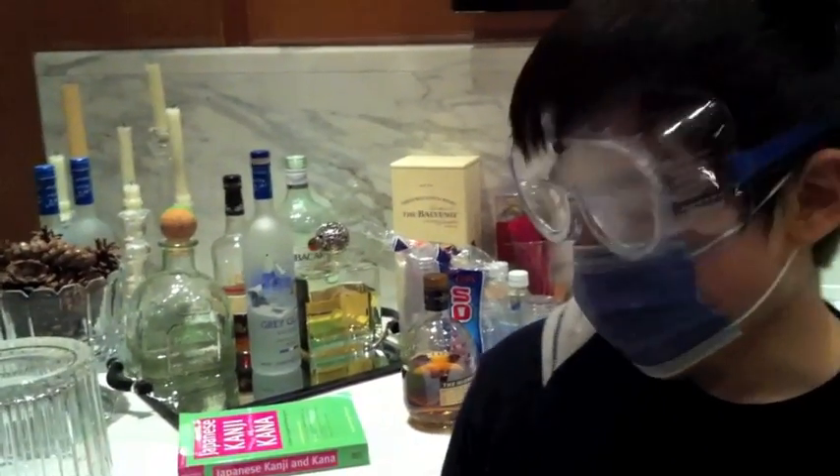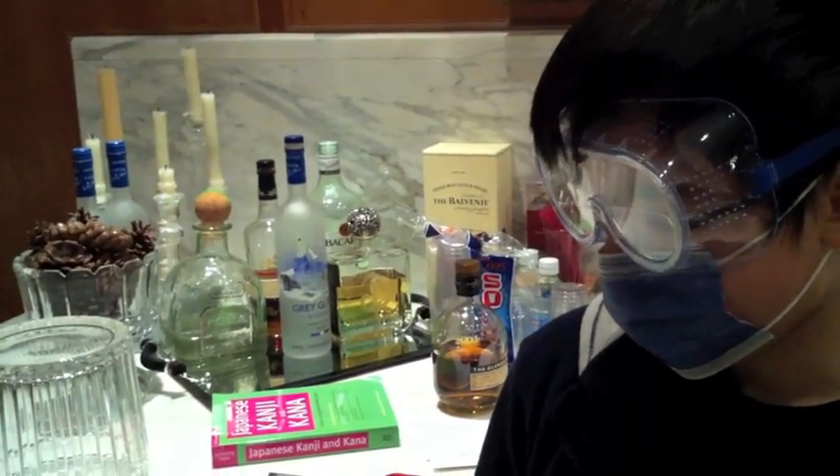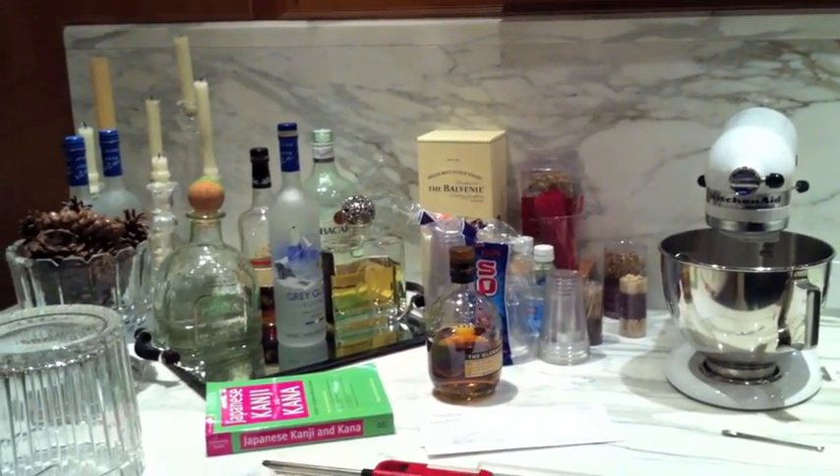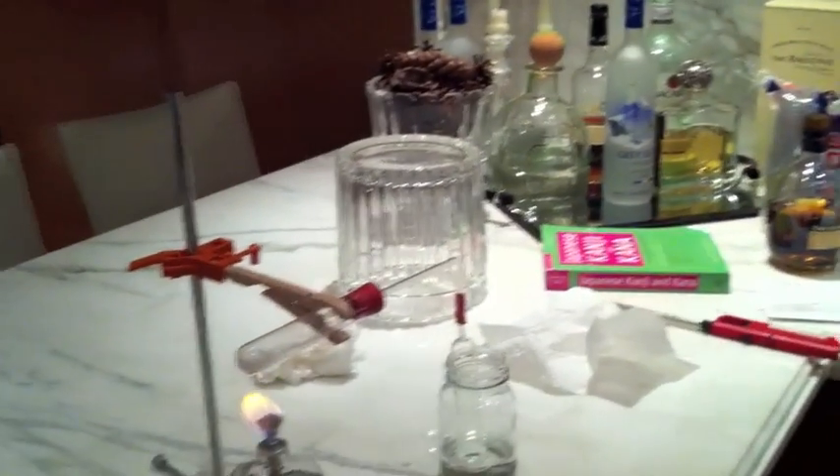Okay. Hello, I'm Steven, and what we're doing here — we're creating a hydrochloric acid solution using sodium chloride and, for the chemical, sodium hydrogen sulfate.